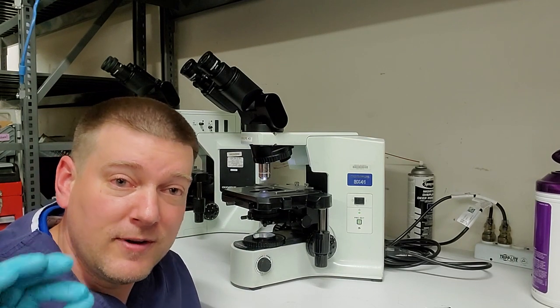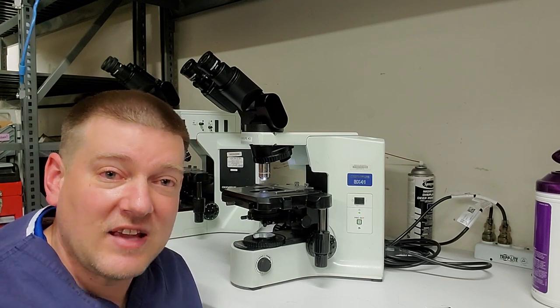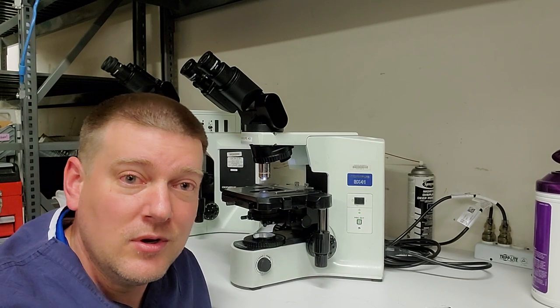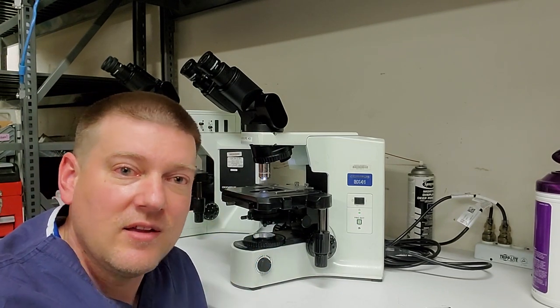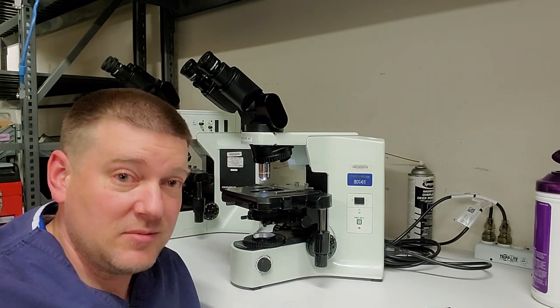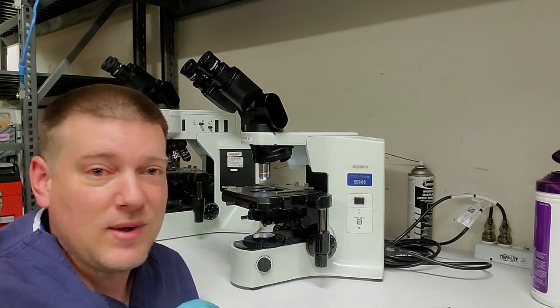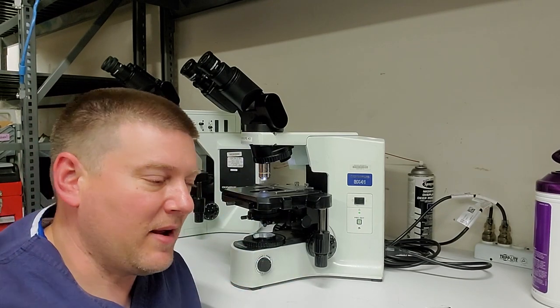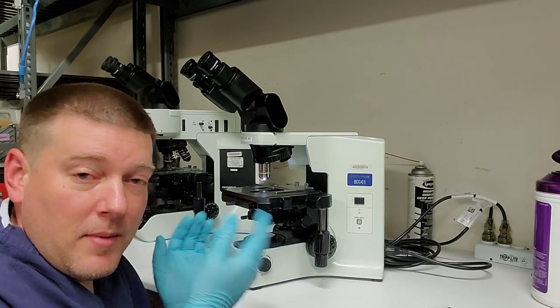Make sure that they're free from defects. Even a slight crack or chip is going to scatter light in an unnatural way, and it's going to cause haze, or it's going to cause light to bounce back at the person's eye in an irregular manner. So any defects whatsoever, that component has to be changed out. And that includes grease contamination or something like that. If you can't get it clean, it's still got some sort of debris or a haze on it, gotta get rid of it, man. But that is a PM on a bright field microscope.